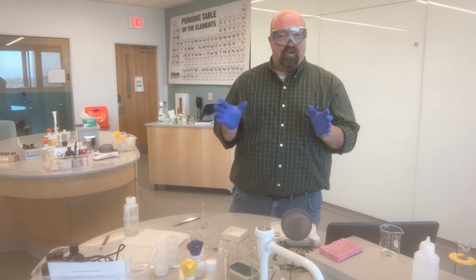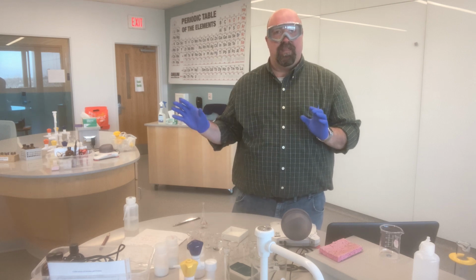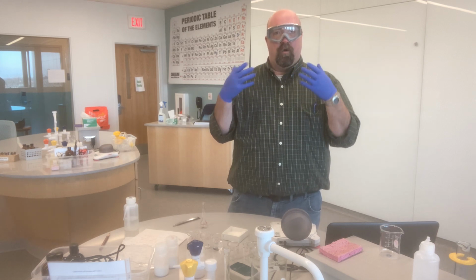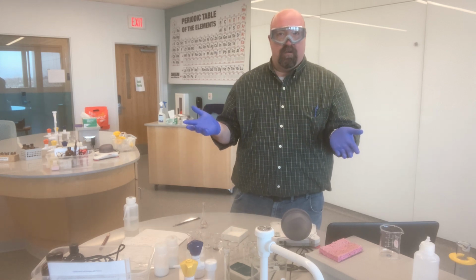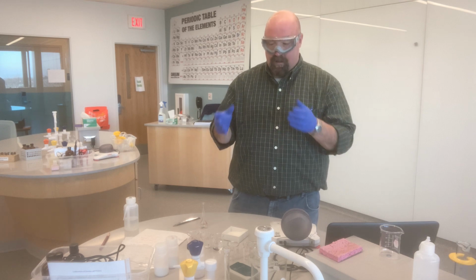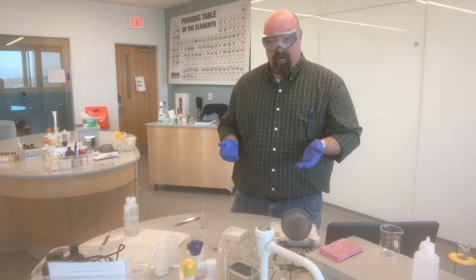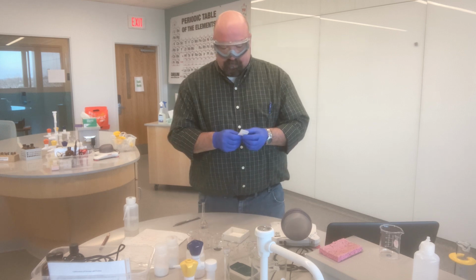So I took about 10 minutes before I even started the video to organize myself, to get beakers ready that were appropriately labeled with the different solution types, so that when I was ready to go for the lab, it's all right here, and I didn't have to go searching for another beaker or write and label something as I'm working. I have a beaker that's labeled 0.025 molar calcium chloride, so that when I made the solution, I could dump it right in. And so then let's just move on to our next one.